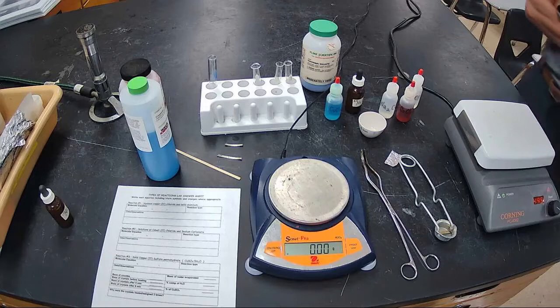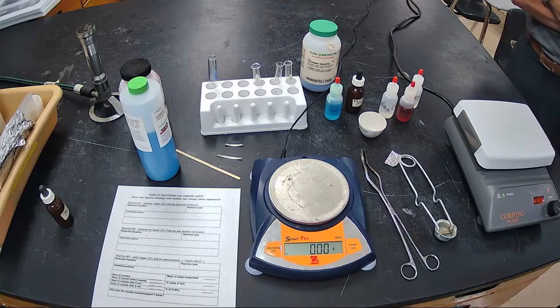Yeah, but that's a boring one in terms of formulas. It's always the same. So we'll mix it up a little bit and have some fun. You guys at home, this will be the best you can do on getting to actually do the reactions. You can see them. And if you ever want to come in after school and do one, maybe we can accommodate you. So you ready to start?